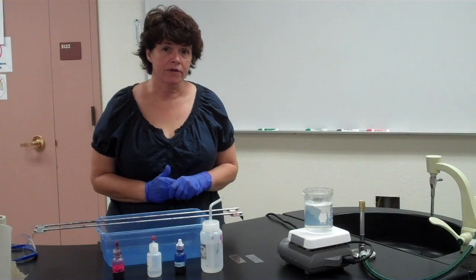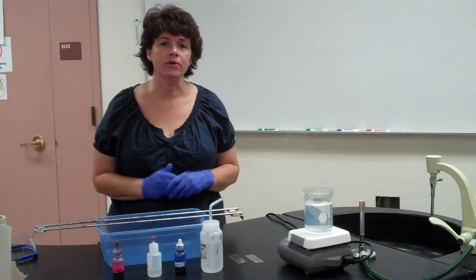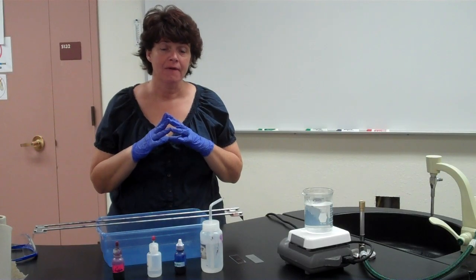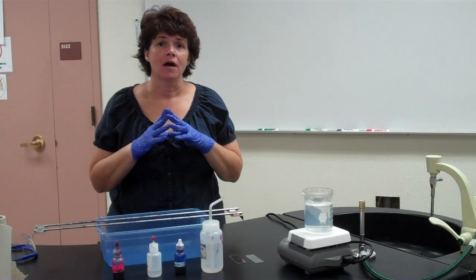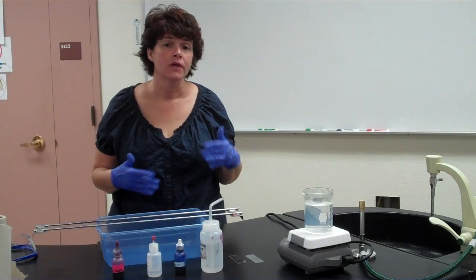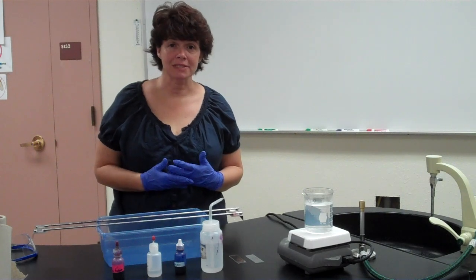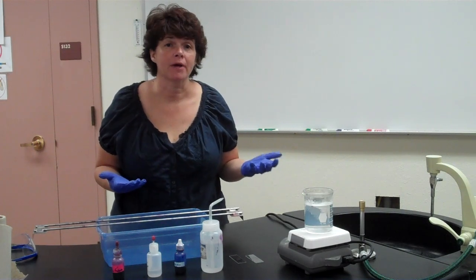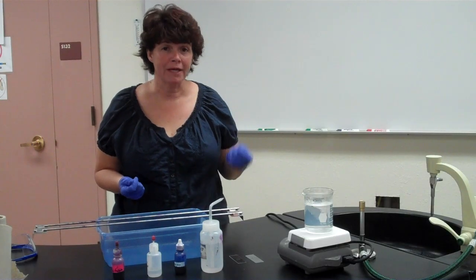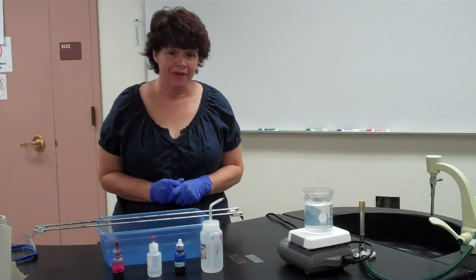These bacteria are special in the fact that they have an outer waxy coat outside their wall called mycolic acid. Mycolic acid is highly resistant, and you just can't give it any antibiotic to kill it. So if a person has either tuberculosis or leprosy or one of those types of diseases, you can't treat them with a regular antibiotic. You have to figure out an antibiotic that either breaks down that mycolic acid or penetrates to get to the wall, okay, the regular wall. So we're going to do an acid-fast stain.